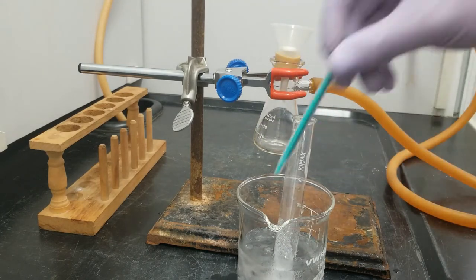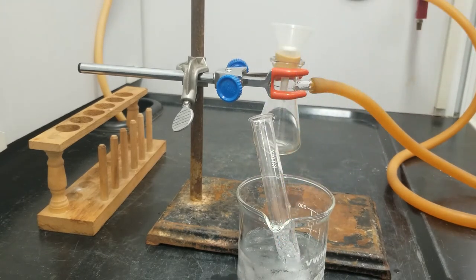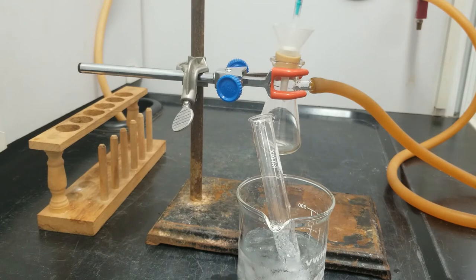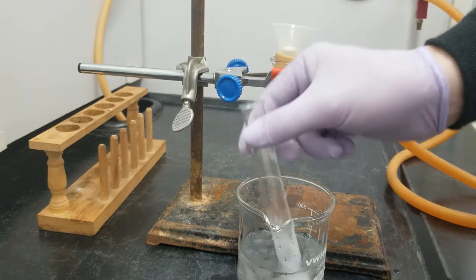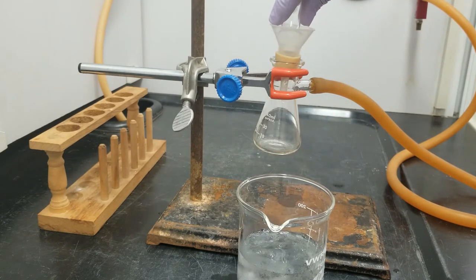And to adhere that filter paper to the Hirsch funnel, I'm going to use a little bit of cold water. Just a few drops. And pour our mixture in.